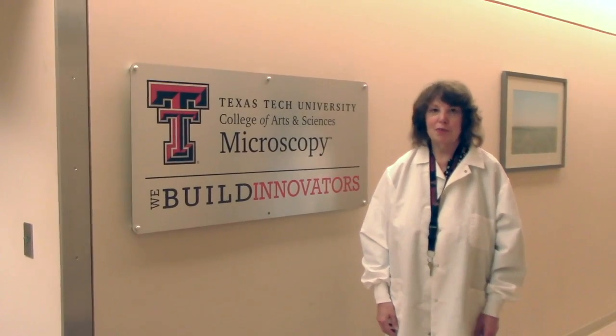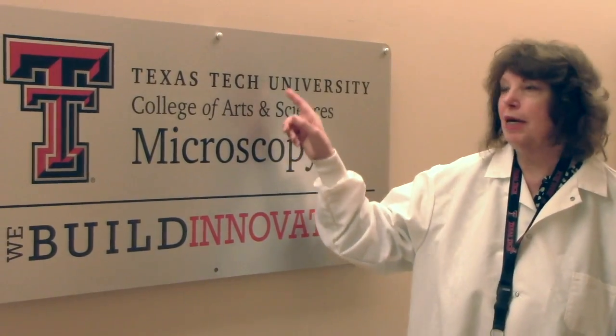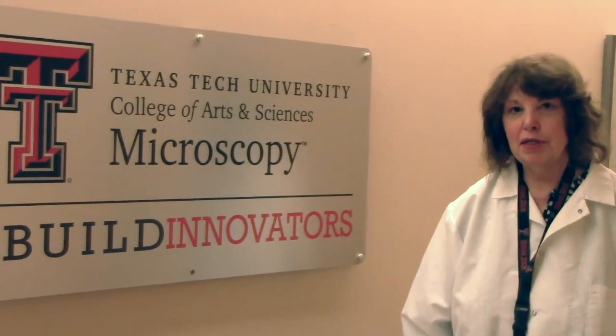Hello fellow scientists. My name is Mary Catherine Hastert and I'm a research scientist in the College of Arts and Sciences Microscopy at Texas Tech University. My job is to help professors and students process their samples and take pictures on the electron microscope so that they can publish their research data. I was really excited and glad to be asked to help you process your samples on the project I'm calling Space Spores, so that we can image your samples on the electron microscope. Today I'm going to show you a few of the steps that we took to process those samples. Come into the lab with me and we'll get started.